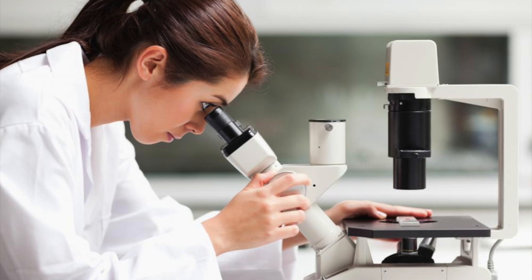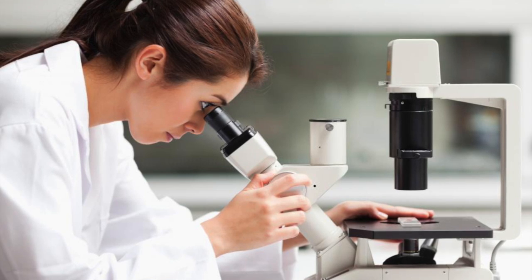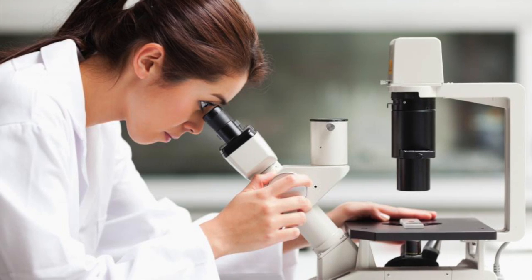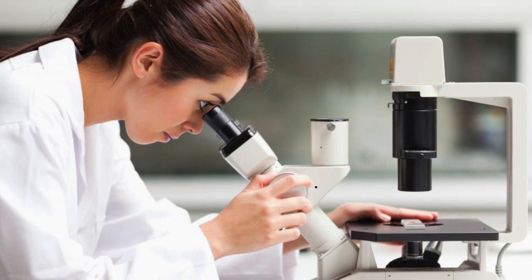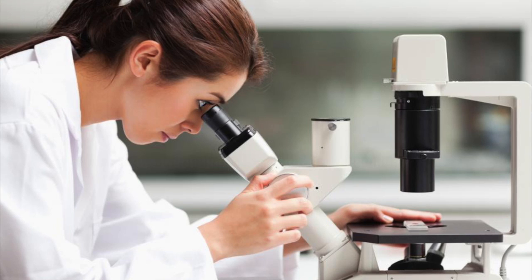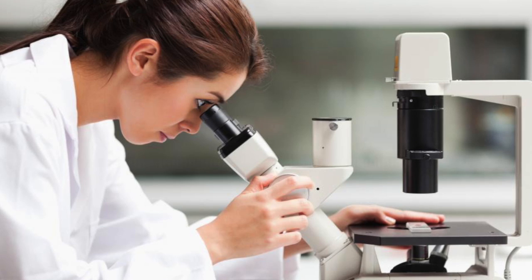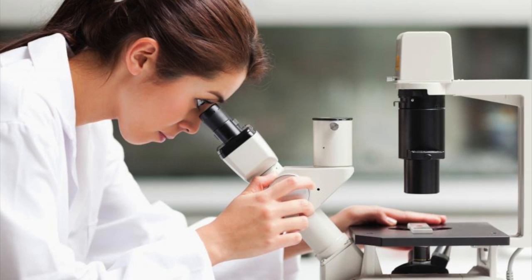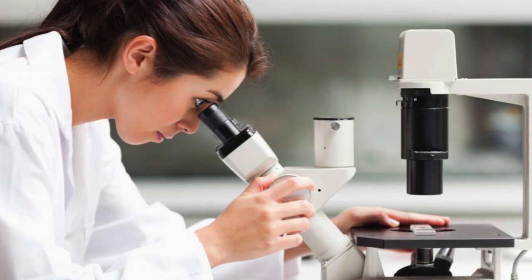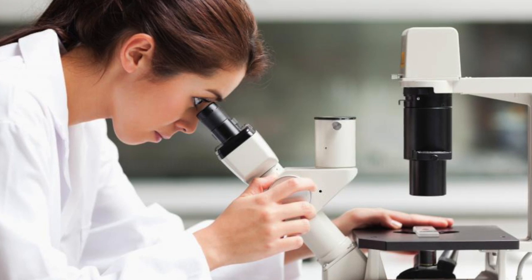For gram staining, we used a sterile inoculating loop to smear our unknown bacteria onto a slide. Then we heated the slide. After the bacteria was dried, we added crystal violet, iodine, ethanol, and safranin. After further examination under our microscope, we could determine that our unknown was gram-negative and bacillus-shaped. Due to our bacteria being gram-negative, we can say that the crystal violet didn't soak into the thin peptidoglycan layer because it's too big, whereas the safranin is weak and water-soluble and therefore can soak into the thin peptidoglycan, making the bacteria appear reddish-pink.